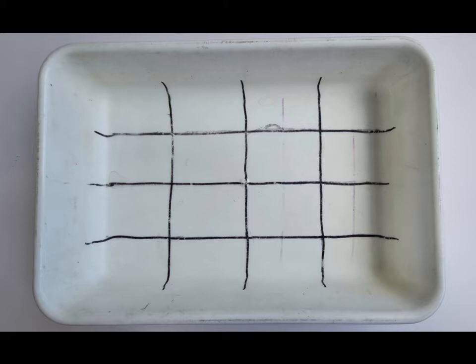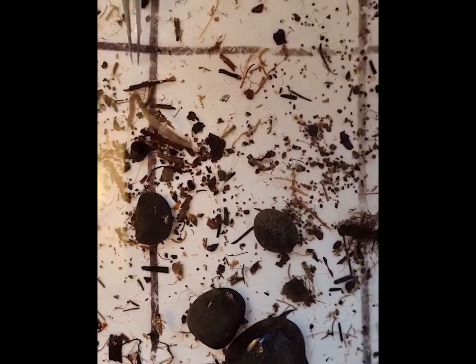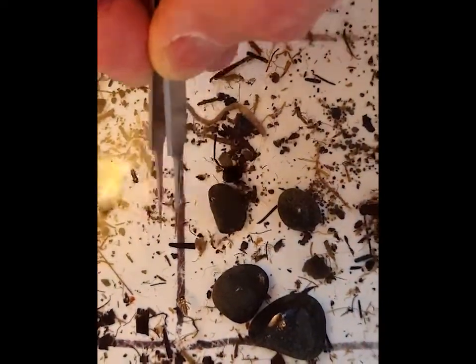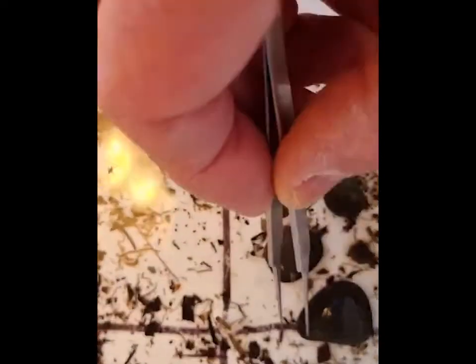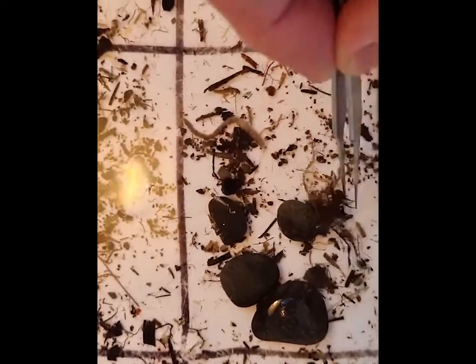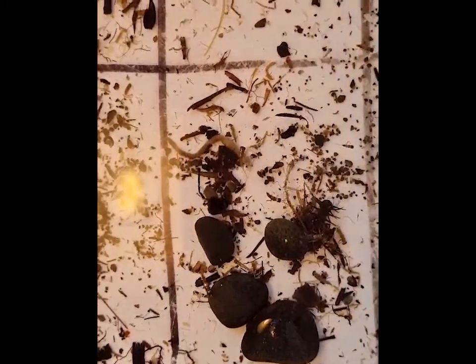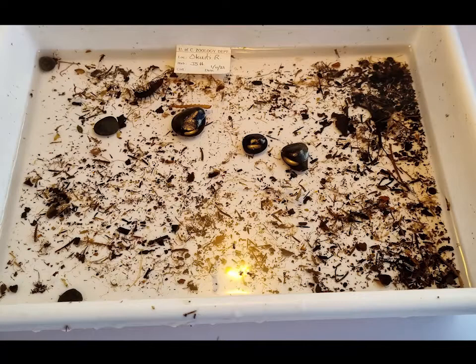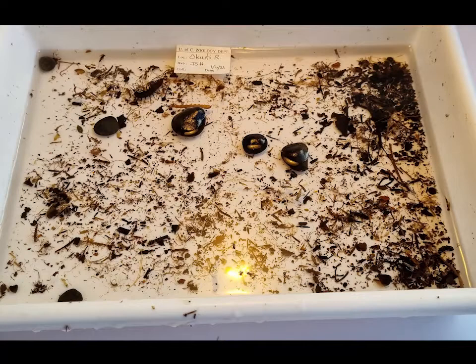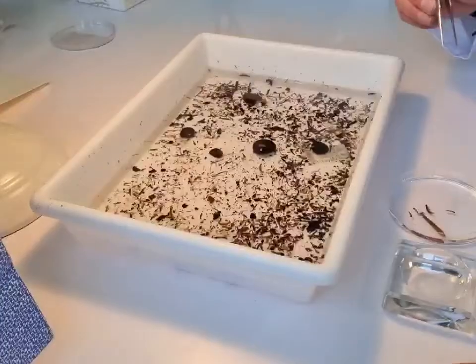You can also split your sample into sub-samples. In this example we've marked the tray into grids, and what we're going to do is count and identify animals which are in a certain number of grids — we might do five grids out of 20 — to get an idea of the sub-sample. That's useful when you've got a really big sample.